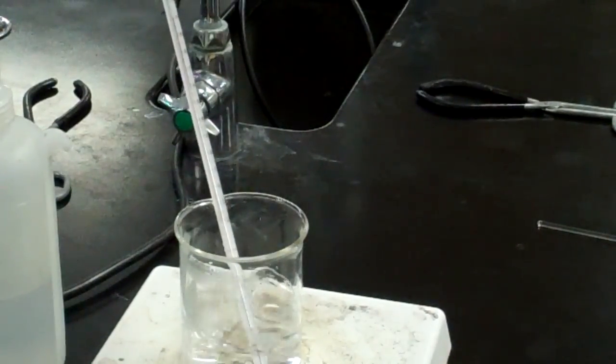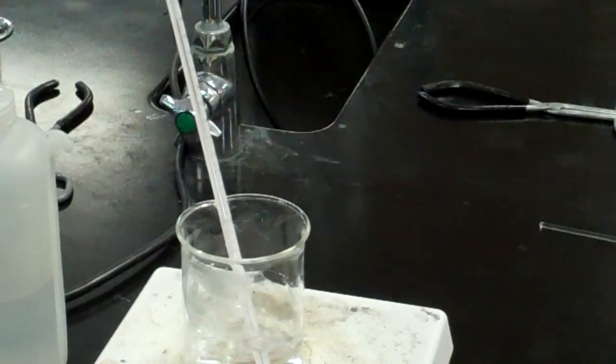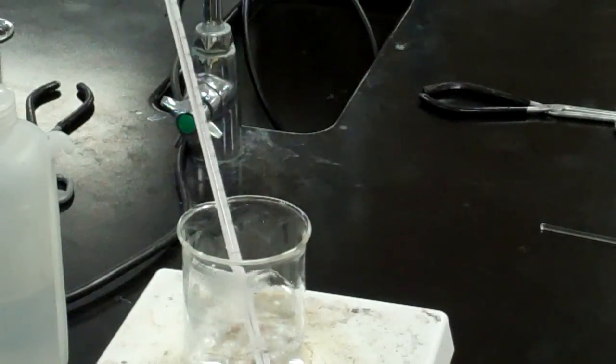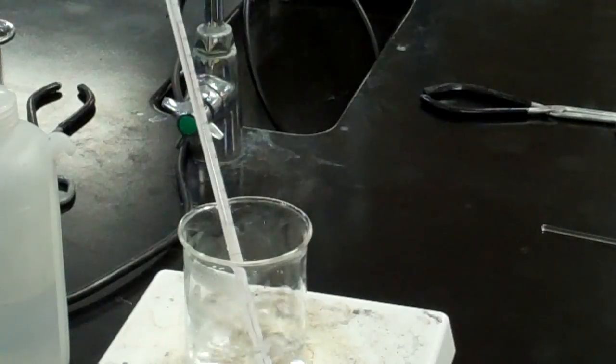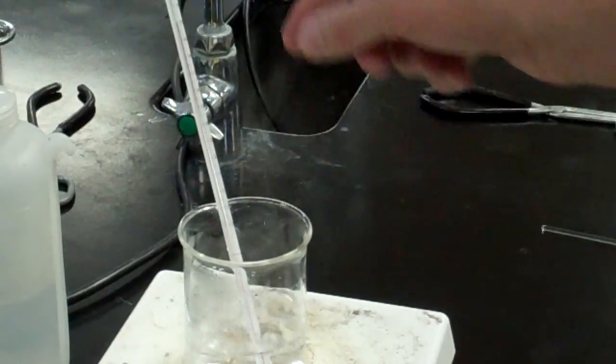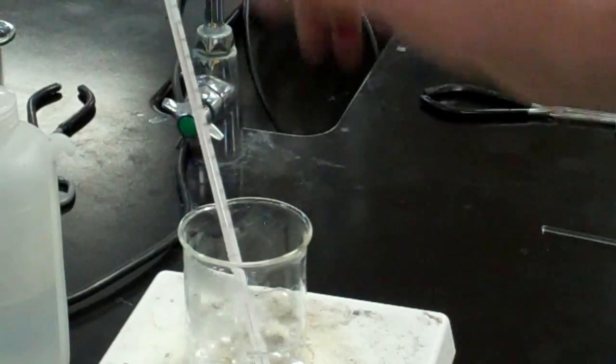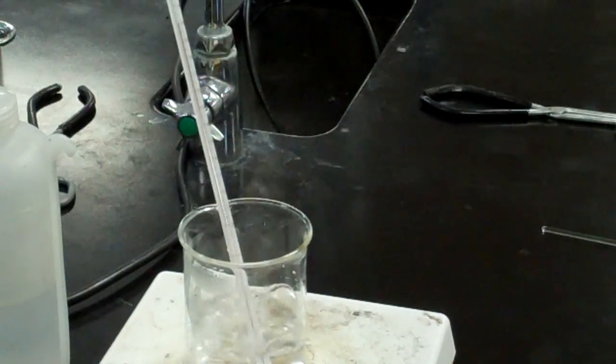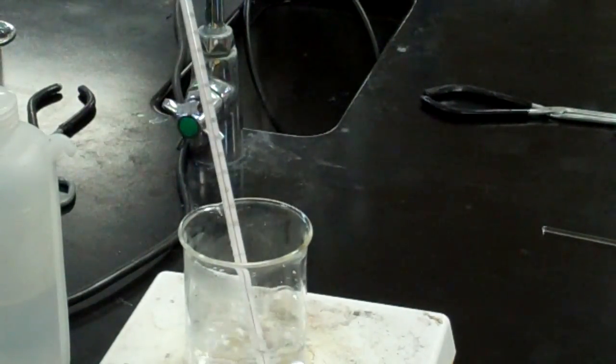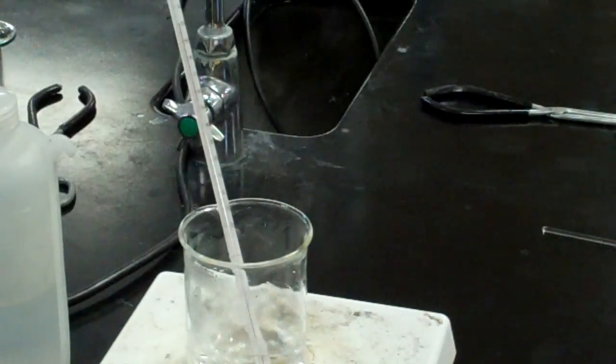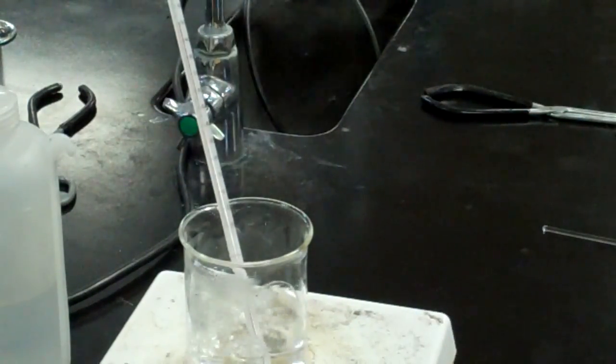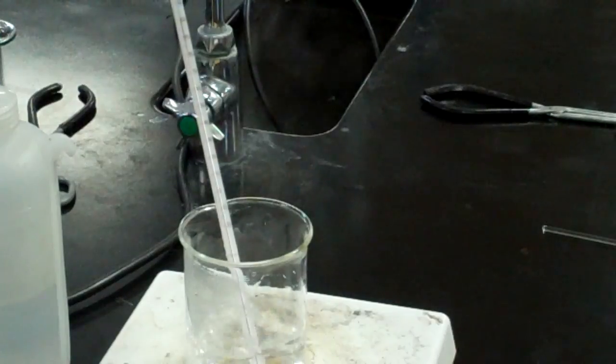This is on this thermometer, it's right at 100 degrees Celsius which is unexpected for here in Salt Lake because we expect the boiling point of water to be a bit lower here at such a high altitude. Nevertheless, we're going to go with that value. Please don't assume the boiling point will be 100. These thermometers are not known for their high degree of accuracy. But they are pretty good at measuring changes in the boiling point which is what we're after today.